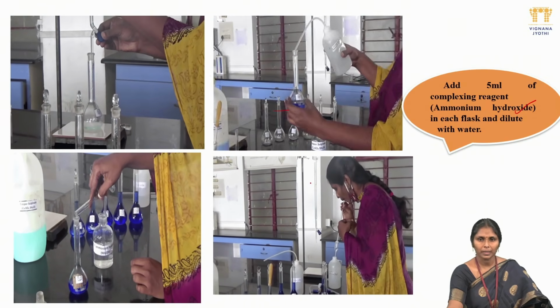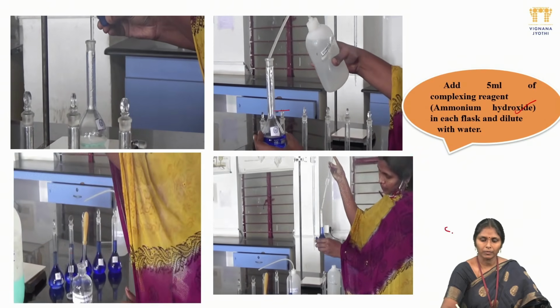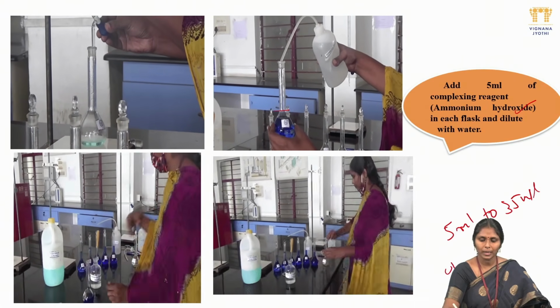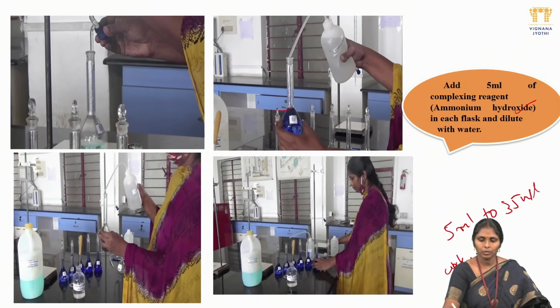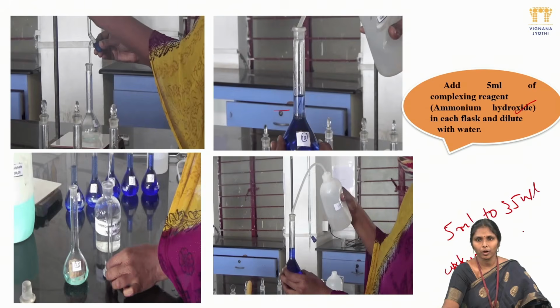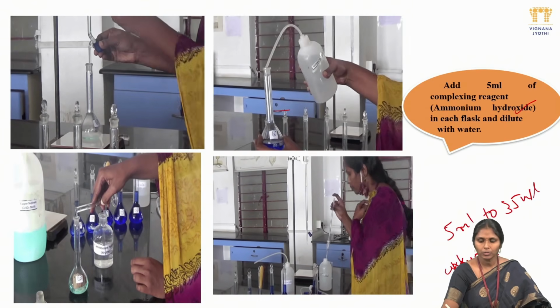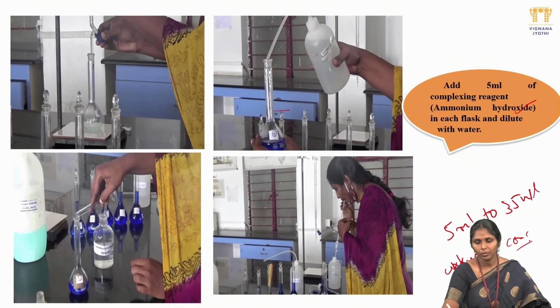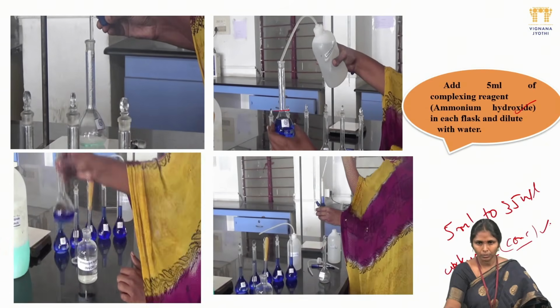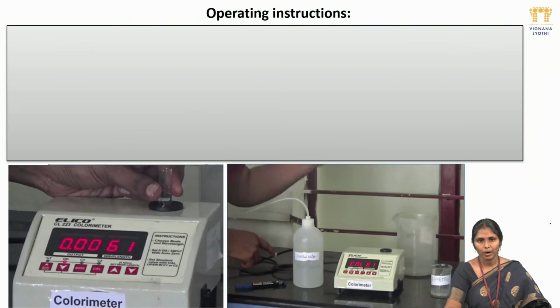In this way we have to prepare the solutions for different concentrations, from 5 ml to 35 ml. We will also give you an unknown solution. You don't know that unknown solution's concentration; you have to find it out by plotting a graph between the volume of copper sulfate on the x-axis and the optical density values on the y-axis. Further, from the unknown solution's concentration, we have to find out how much copper is present in it. Now, coming to the determination of optical density, we have to use an instrument.